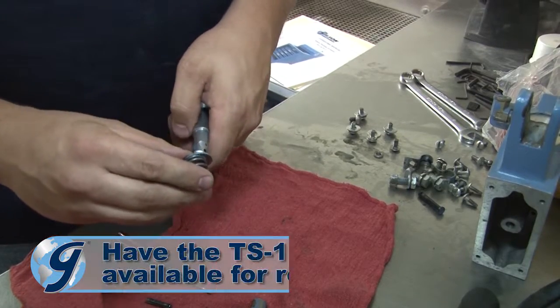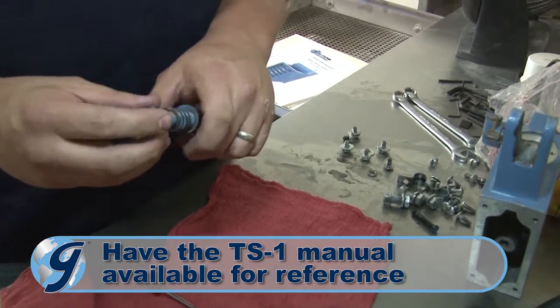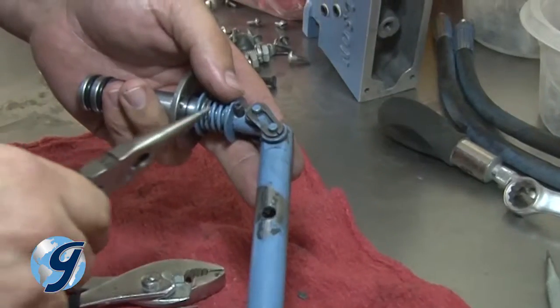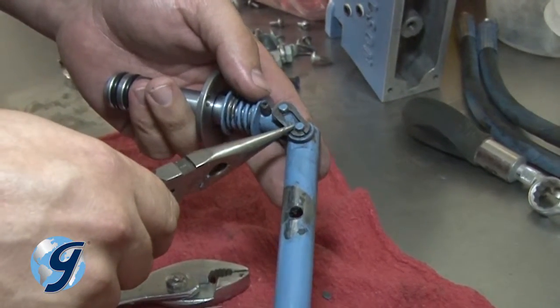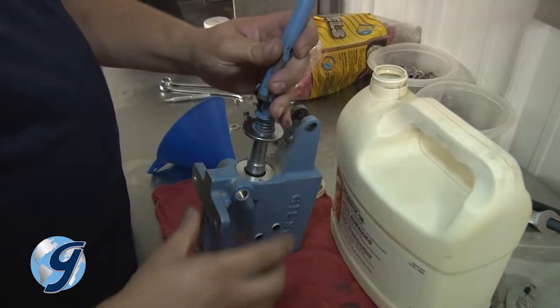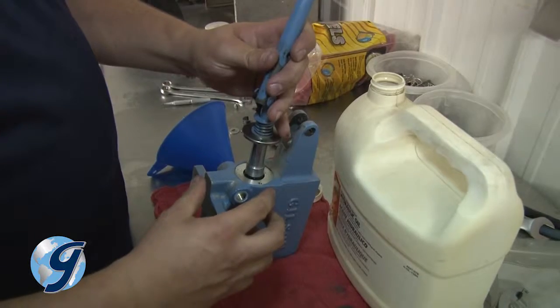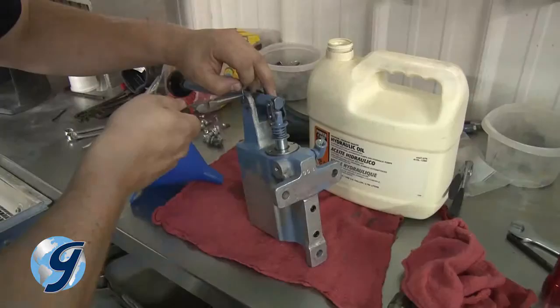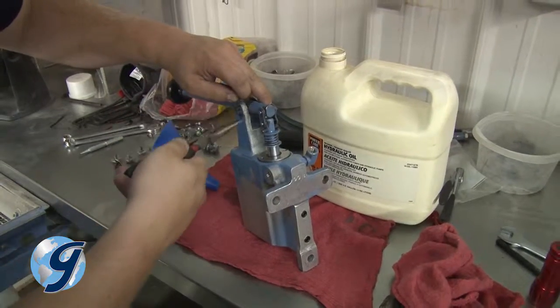Reinstall the new plunger guide and seal, reuse the stroke limiting spring and washers, drive the spring pin back into place, and reattach the connecting link and clip. Be sure to dip the plunger in hydraulic oil before inserting it back into the pump housing. Next, secure the guide and seal with the two original screws and then reattach the handle assembly.